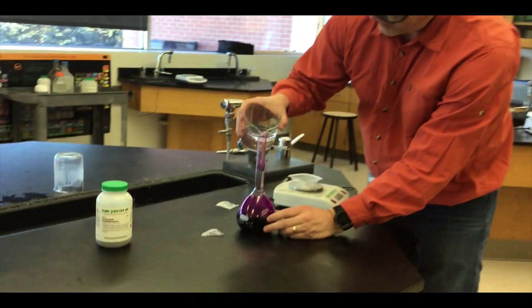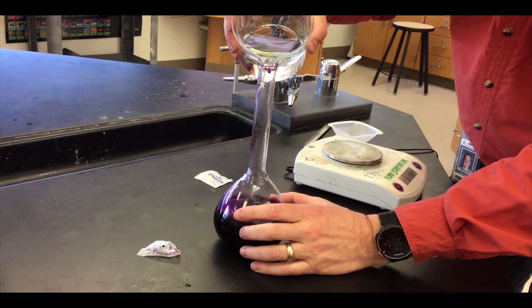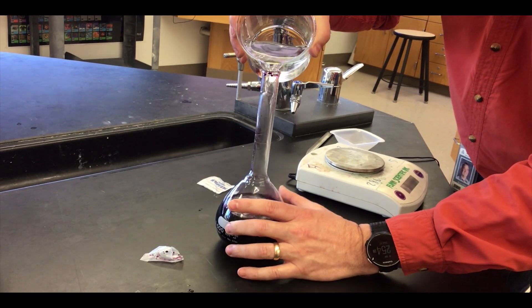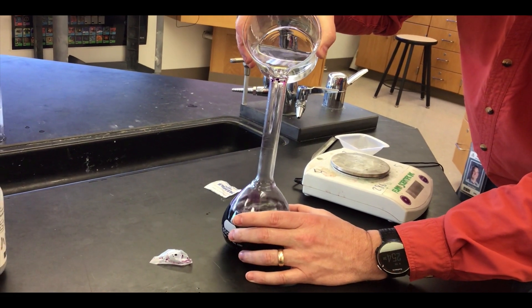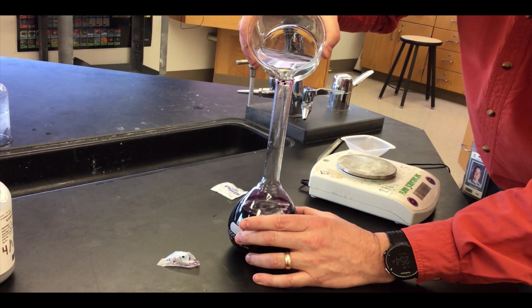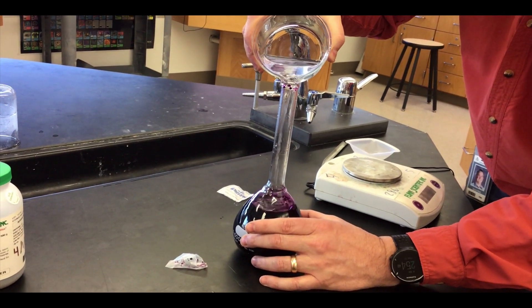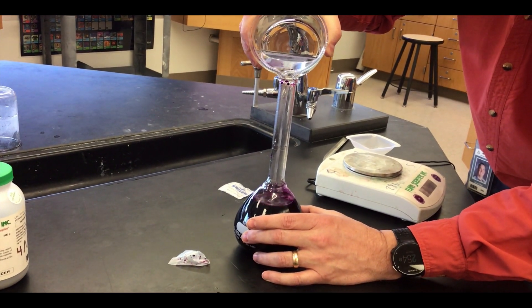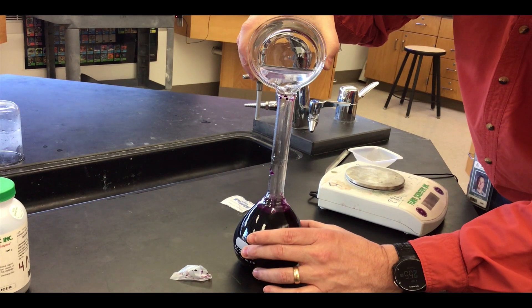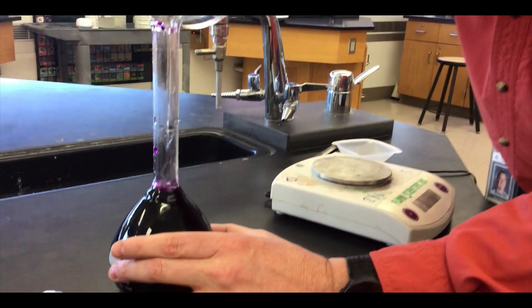So I'm going to add my water, my solvent in there, and I can get some of that solution off of the neck of the bottle as I do that. I still have the line around the neck of the bottle and I'll add this in there until it starts climbing the neck. That will climb very fast, so as you approach the neck with the liquid you want to slow down otherwise it'll shoot past what you're trying to get. So we'll get in there, slow down, pour it up there. And now it starts filling up tremendously fast or faster than you're prepared for oftentimes.